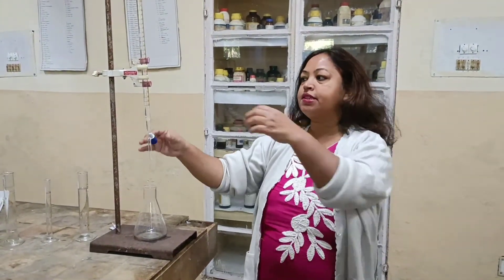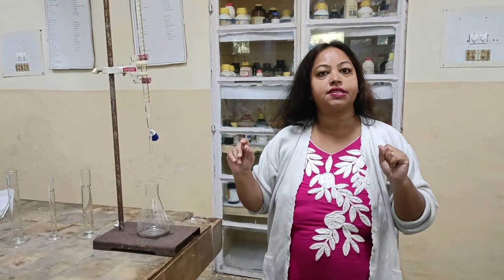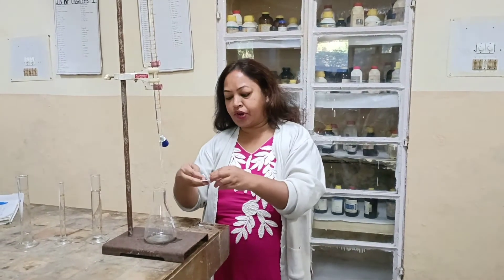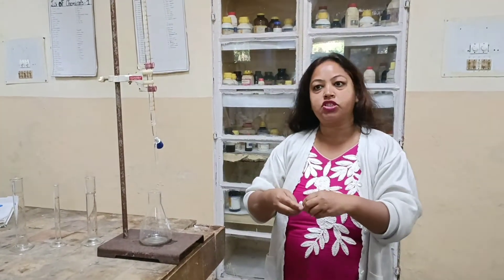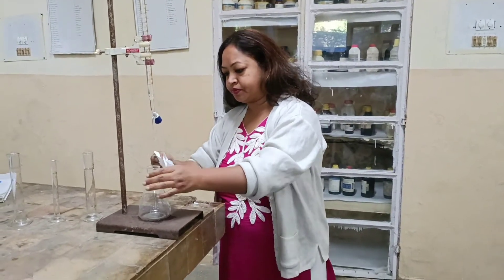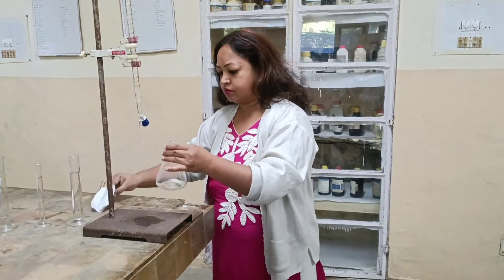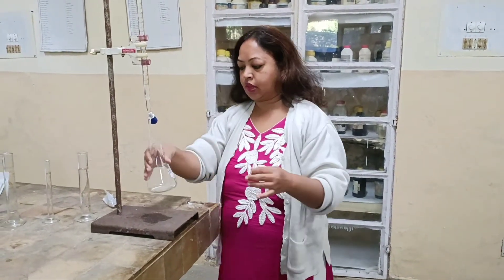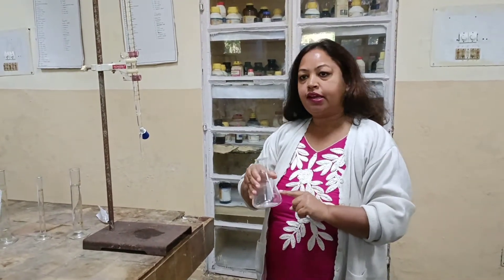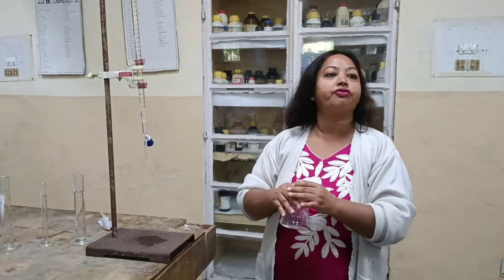We have taken EDTA, which is ethylene diamine tetra acetic acid, in the burette, and we will take 0.5 gram calcium gluconate in the conical flask. So this is calcium gluconate in which calcium is the main metal, and in the burette we have taken 0.05 molar EDTA.